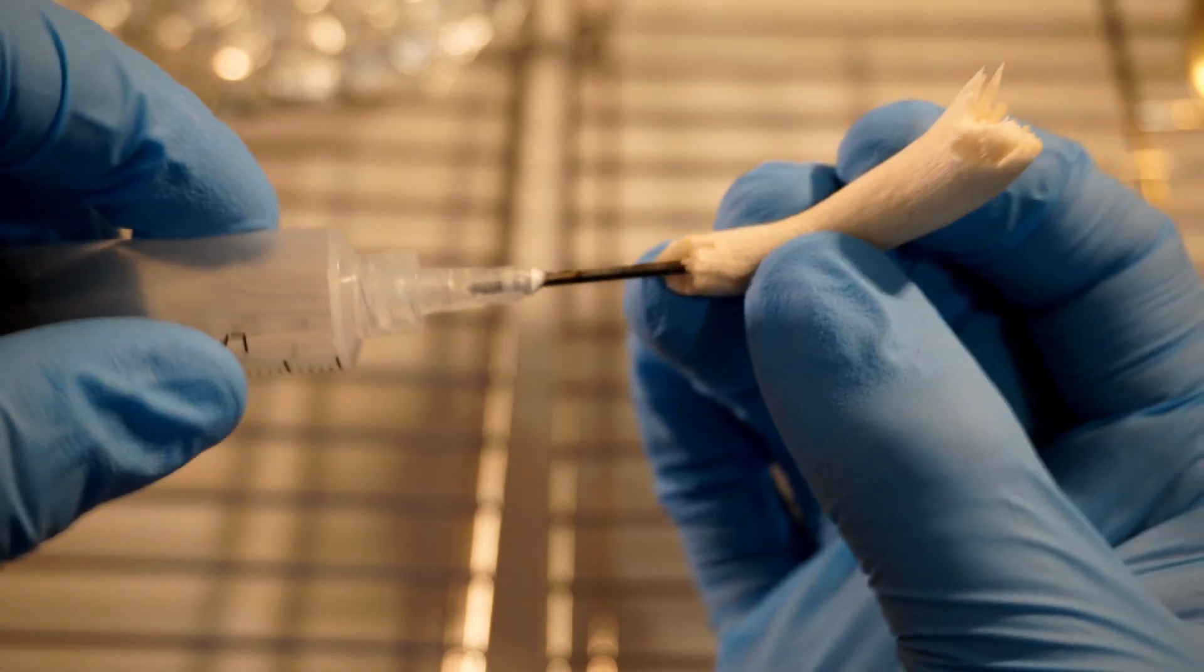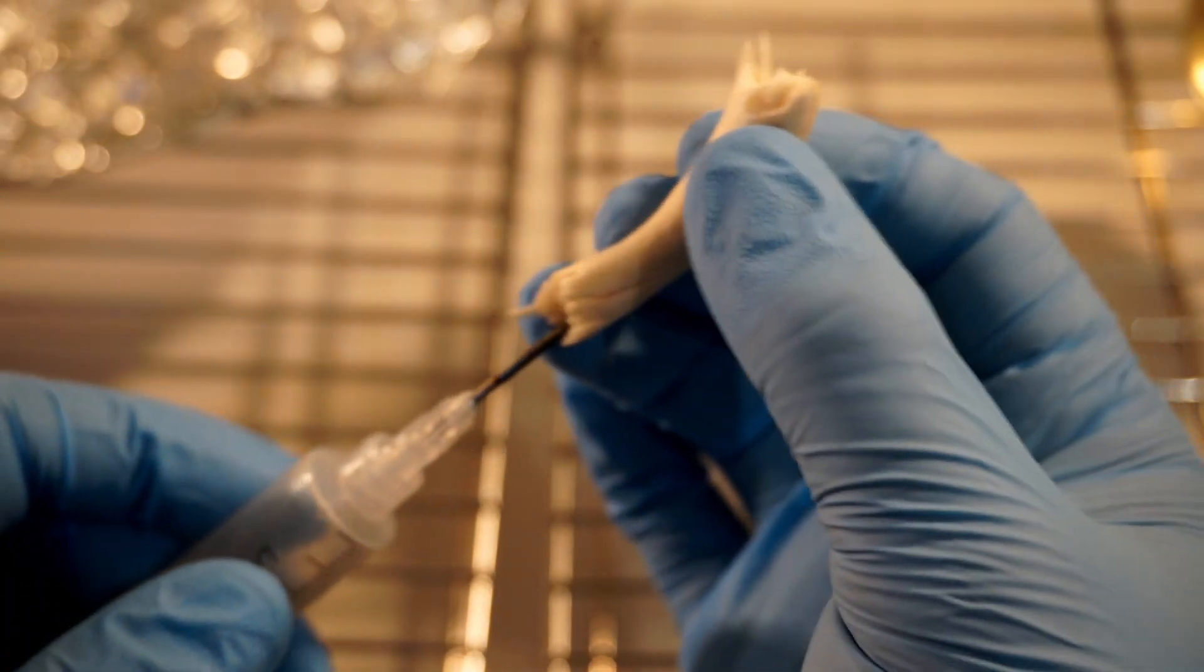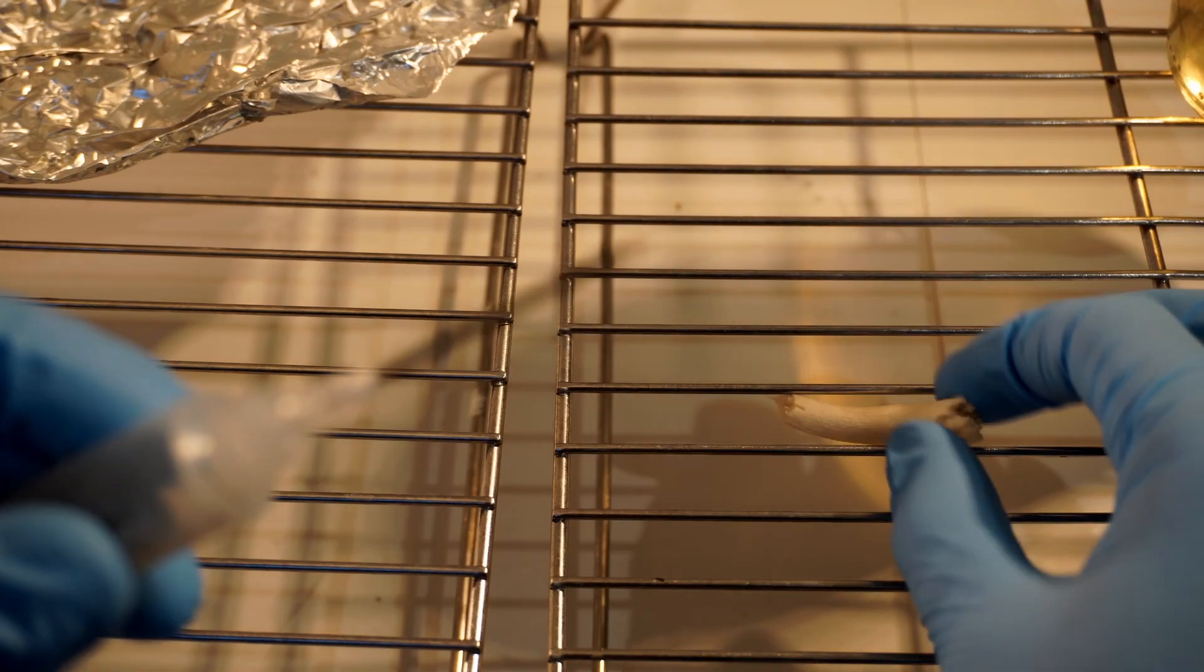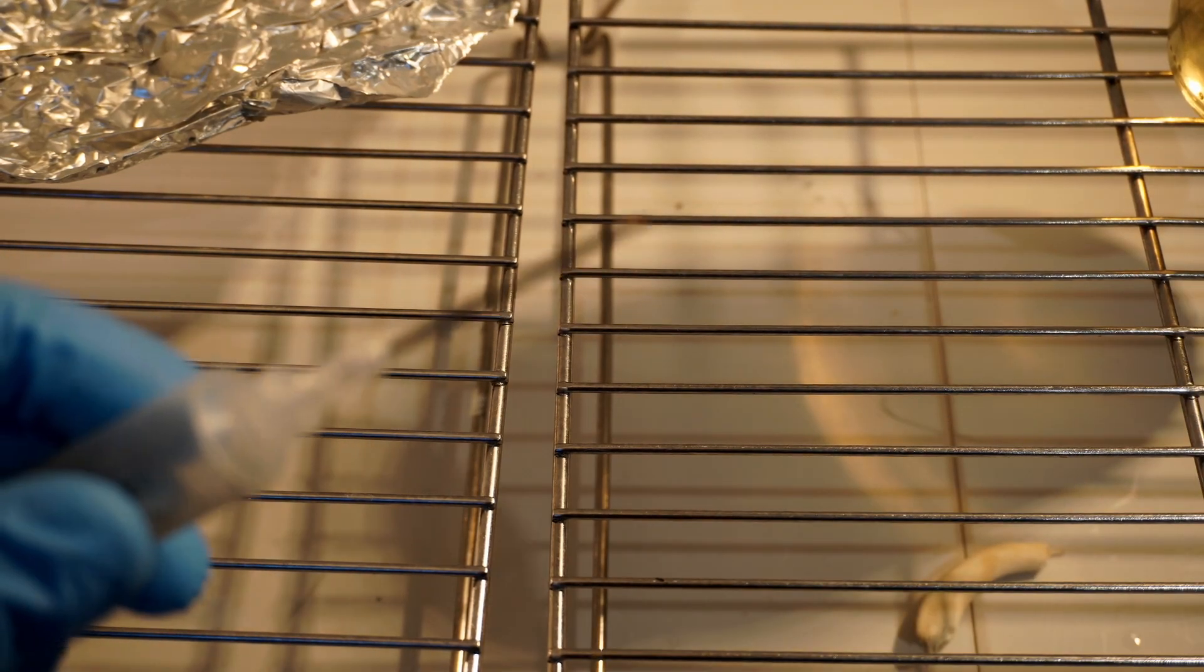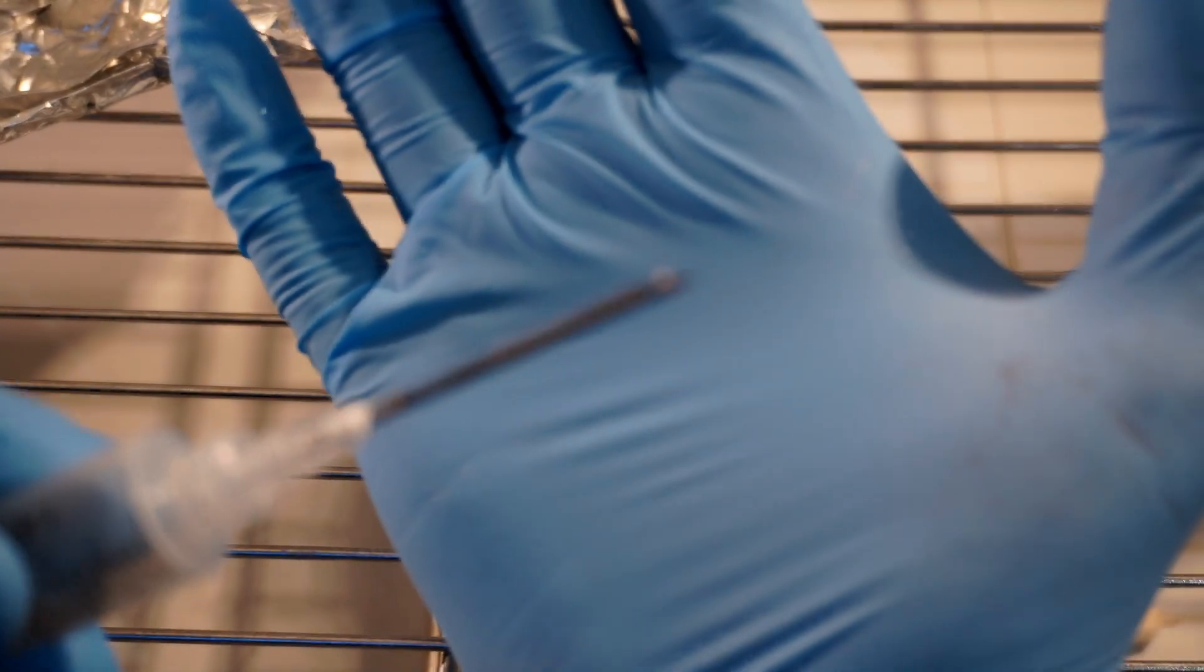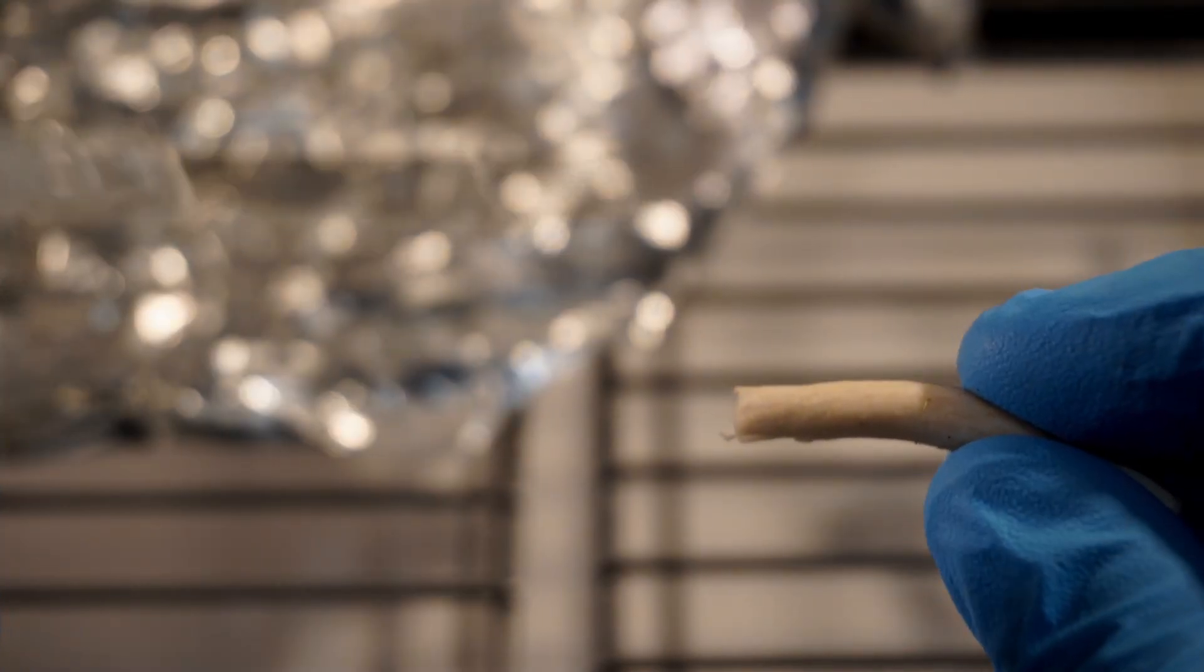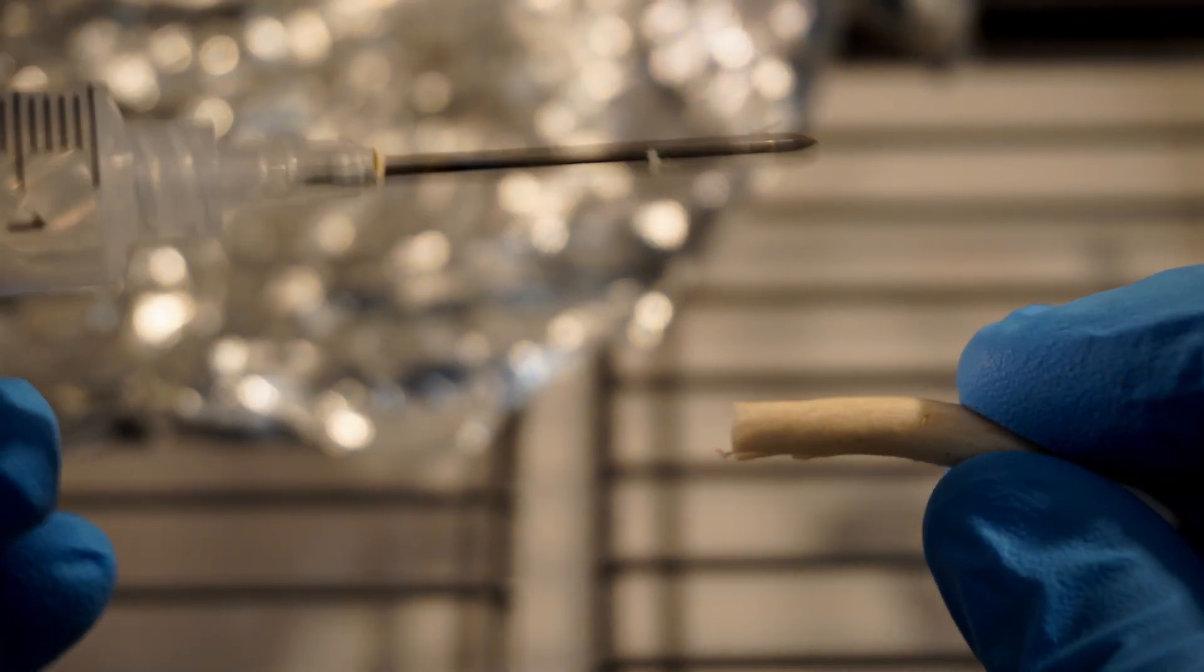Next turn the syringe a few times and then you're going to pull the syringe out. You want to pull the syringe out in a way that the sharp end of the needle kind of snaps the filament or breaks the filament in half. Otherwise if you just pull it out you're just going to take the filament and then pull the needle out and the filament won't come with it.